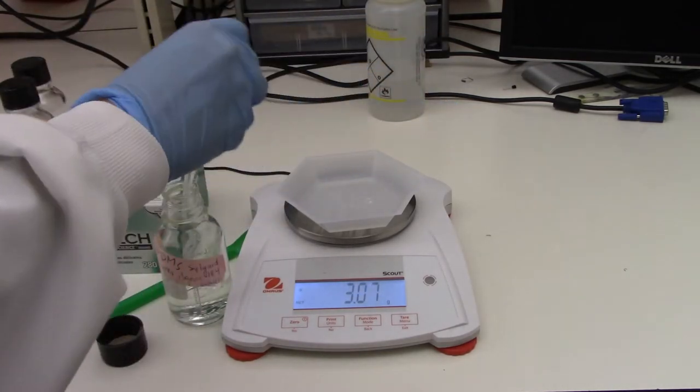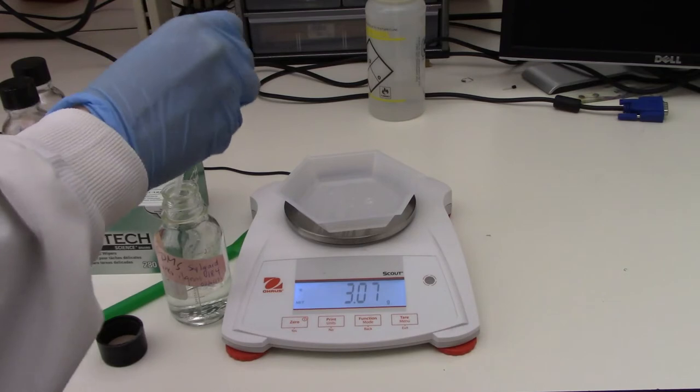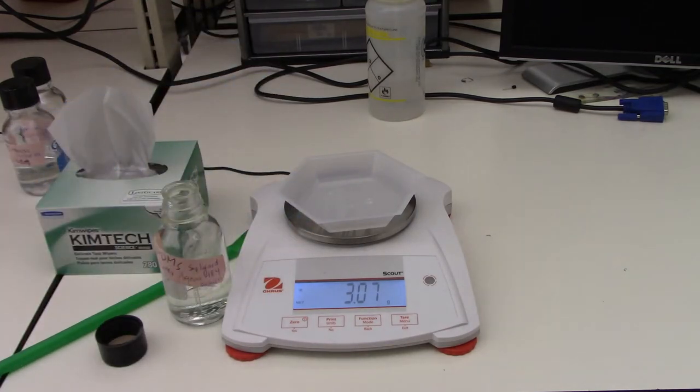All right, it's a little bit high, but again, that's okay. You're not exactly at 30 and three.